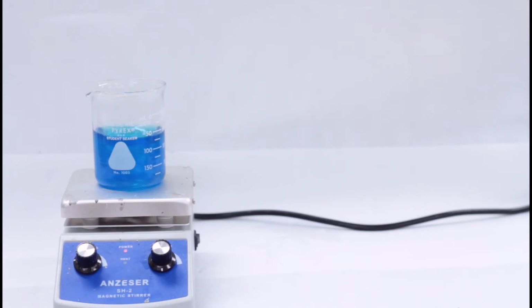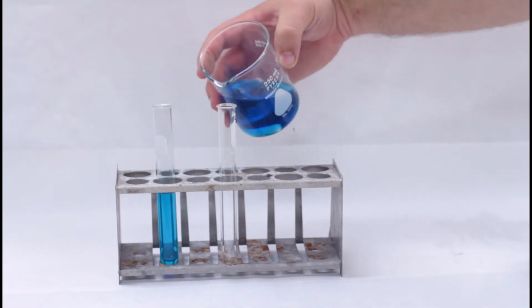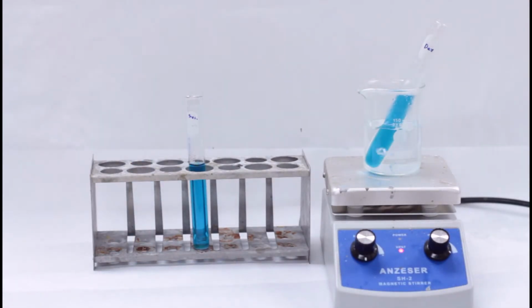We often do chemistry in a liquid solution with certain liquids, solids, or gases dissolved in that solution that are able to react to form interesting products. We use liquid solutions because we're able to do liquids at a pretty reasonable temperature without a lot of pressure, but with still a fair amount of speed to the reaction. Paints, soaps, and even soda and the flavorings for candy are all chemicals that are made in a solution. We'll produce these solutions and then see what they look like in action.